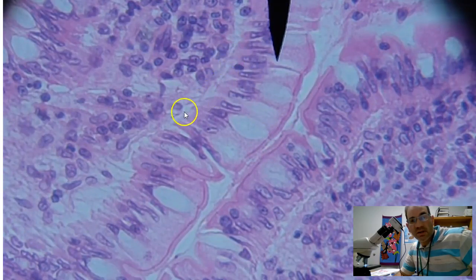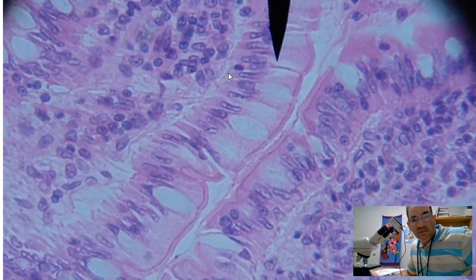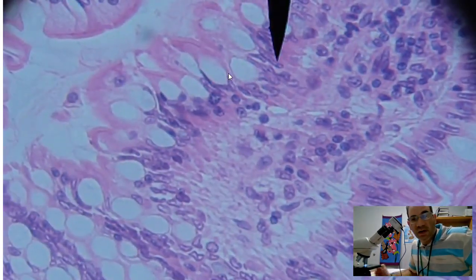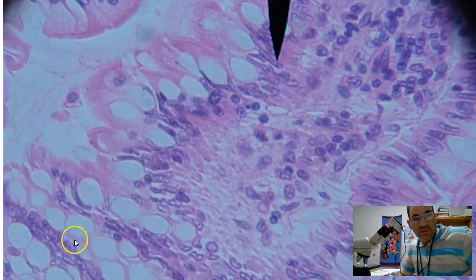The basement membrane is going to be where the epithelium is attached to deeper tissues. So you can see one side of this villus right here, and this intestine is right here. And we've got some tissue in between, and then we've got our other side of the epithelium over here. This side doesn't look nearly as good. So that is simple columnar epithelium.